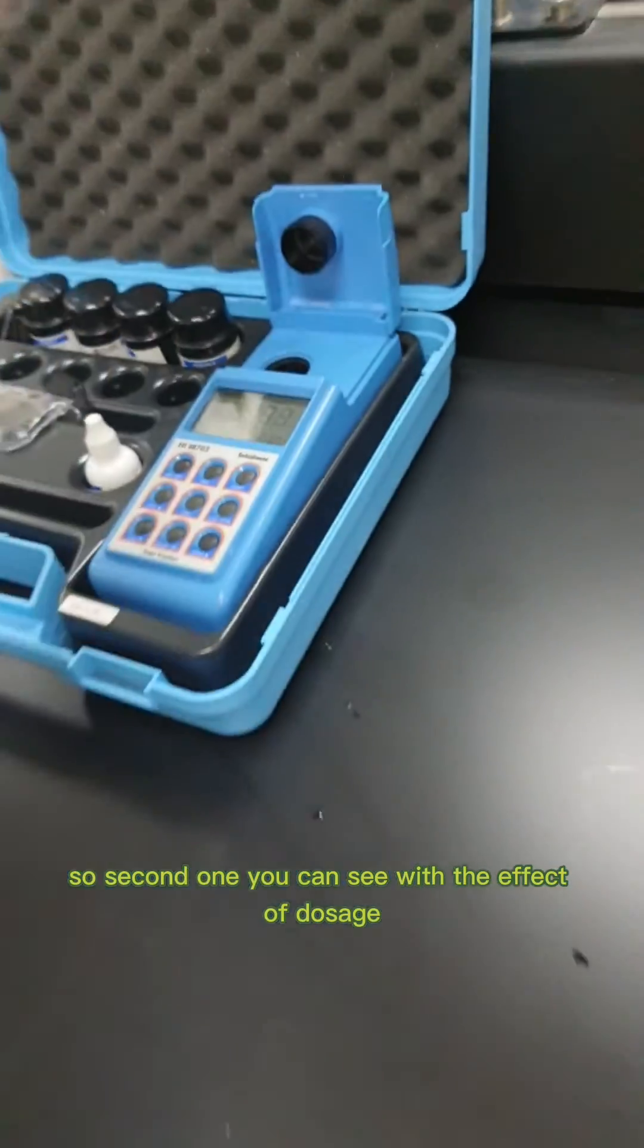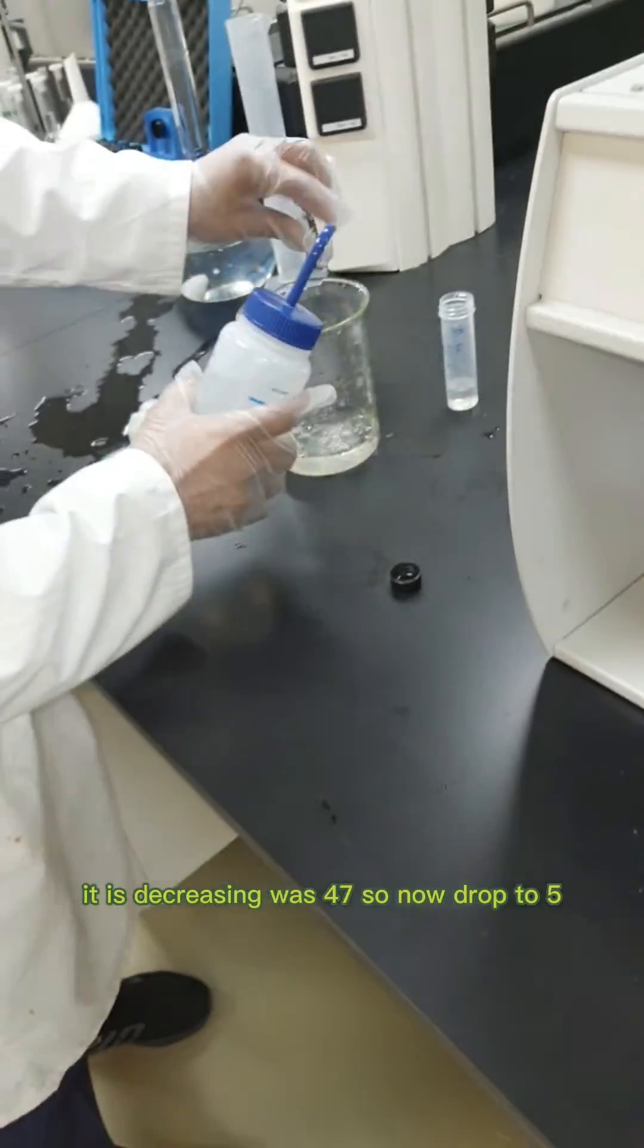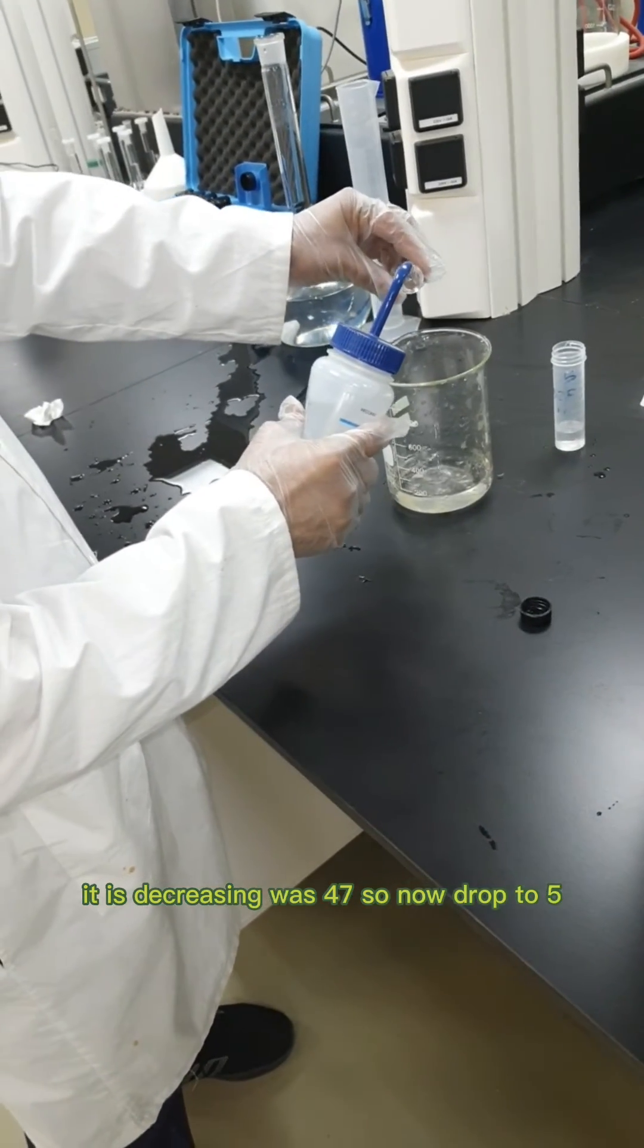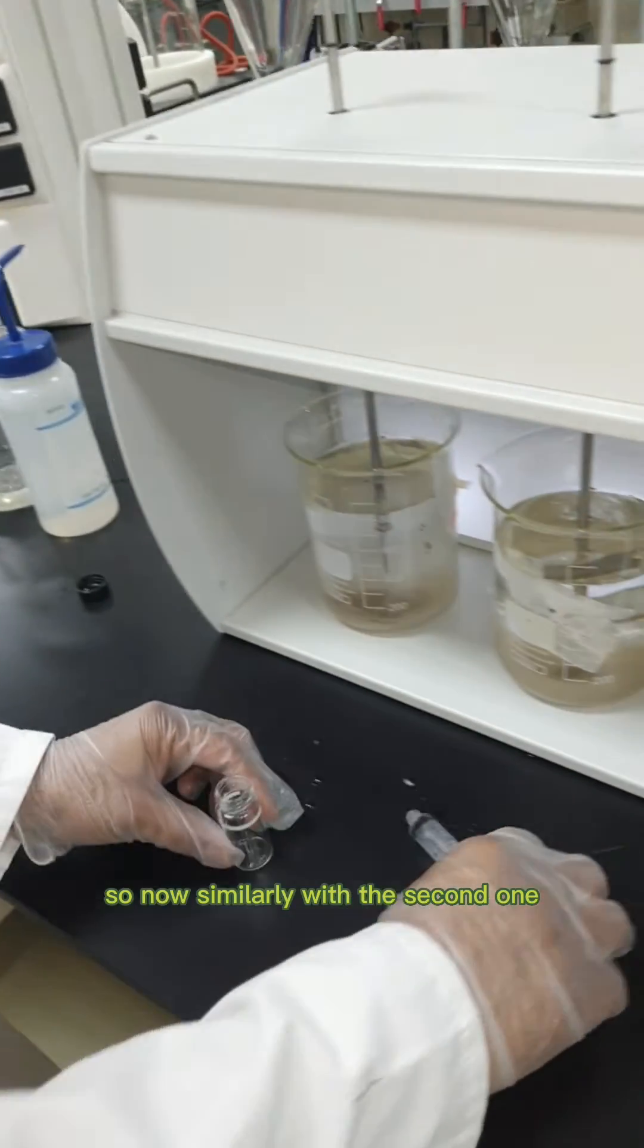For the second one, you can see with the effect of dosage it is decreasing. It was 47, now dropped to 5. This is 4.87. We will check the last one.